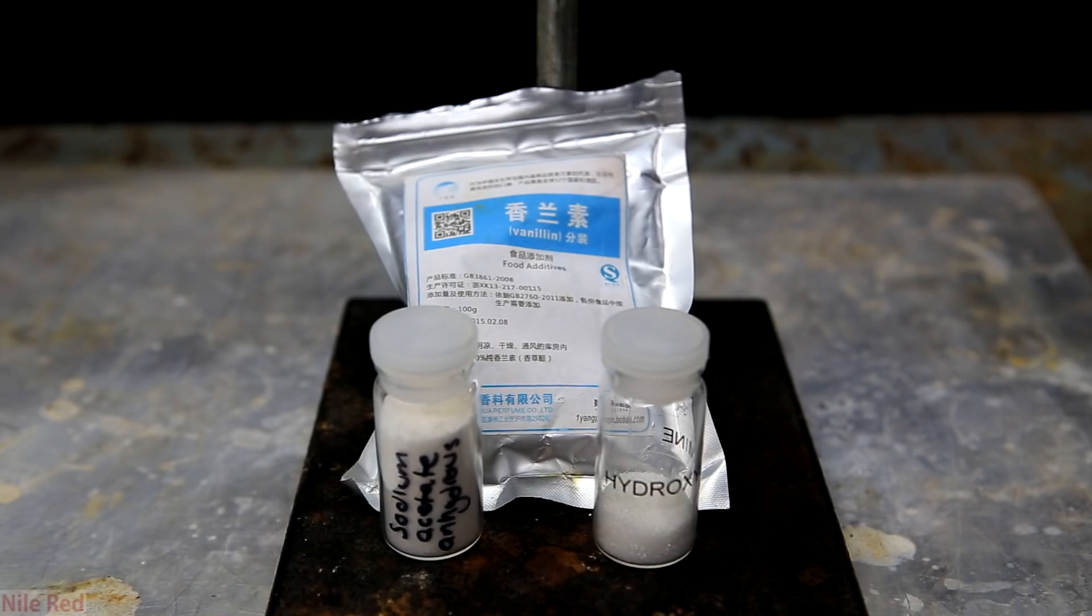So these are all the chemicals that are needed to carry out this synthesis. We're gonna need some vanillin, some sodium acetate, and some hydroxylamine hydrochloride.